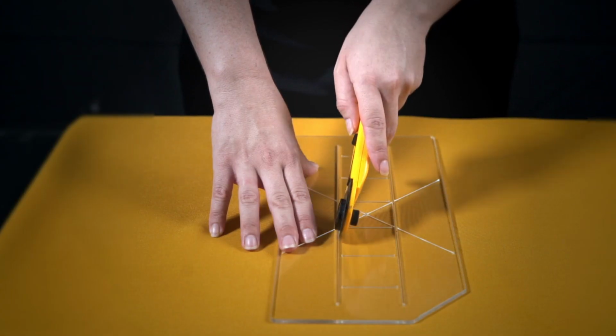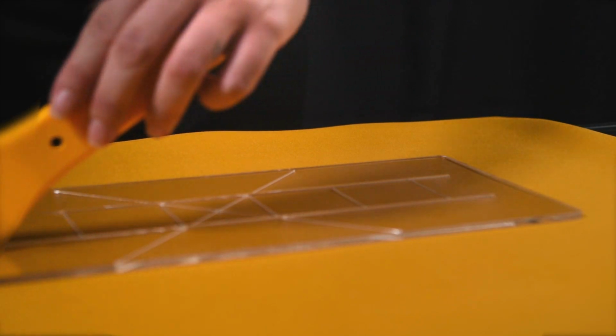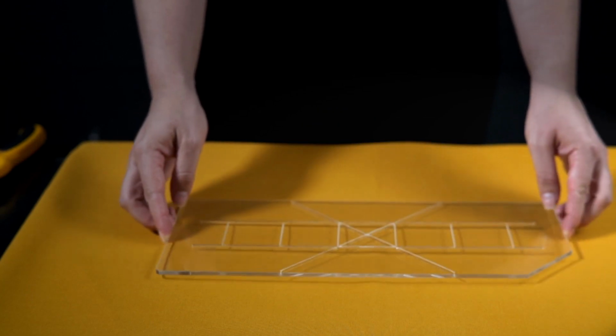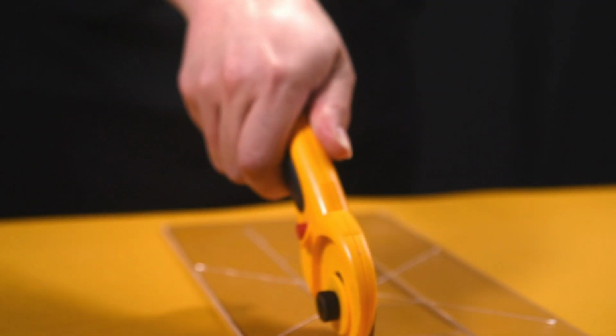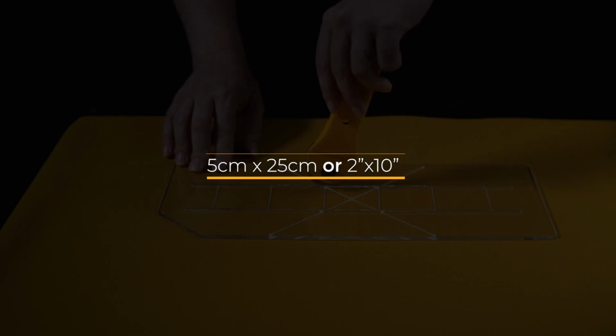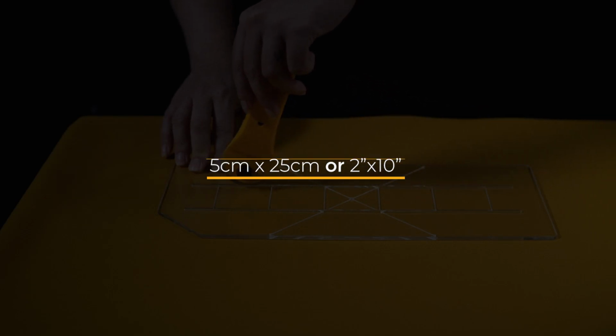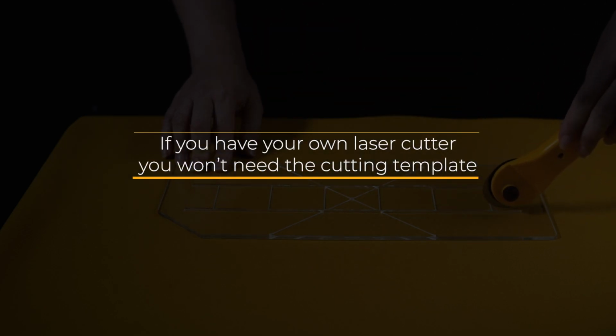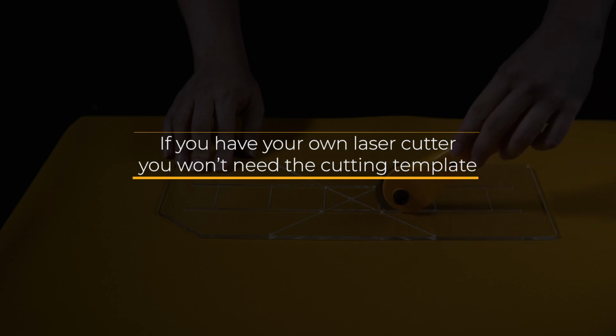Cut and mark your 3 sample fabric strips. Length, parallel with the grain line; width, perpendicular to the grain line; and bias, diagonally across the grain line. Use the cutting template and rotary cutter to achieve accurate dimensions: 5 cm by 25 cm, or 2 inches by 10 inches. If you have your own laser cutter, you won't need the cutting template. Just cut the 3 sample fabric strips at the size and orientations mentioned previously.